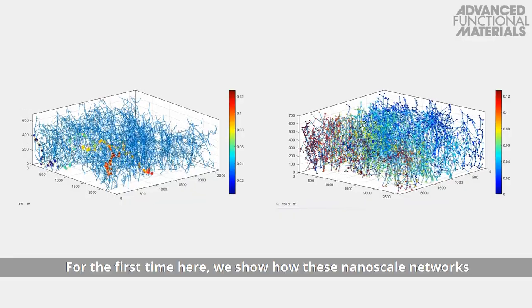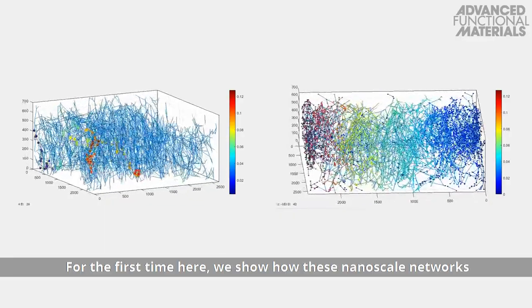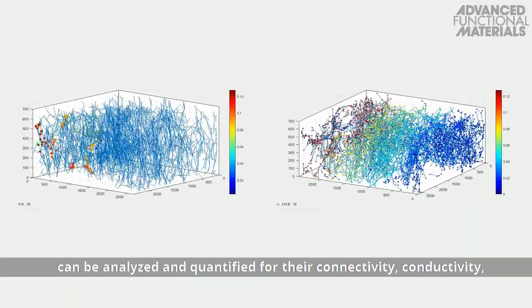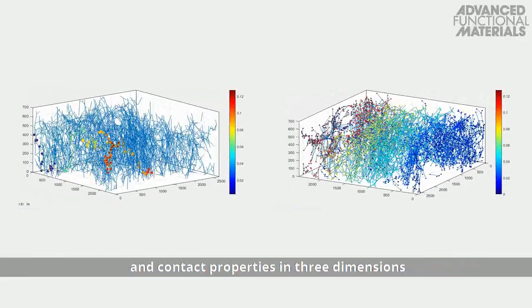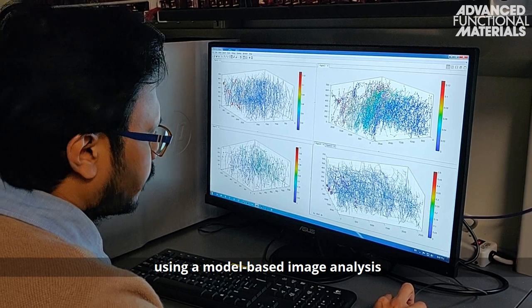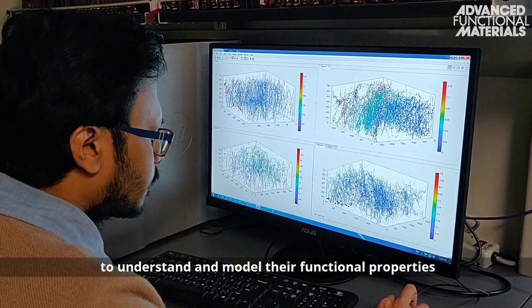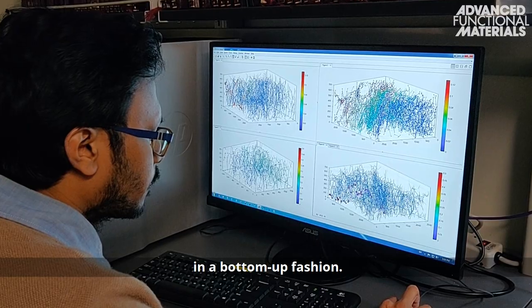For the first time, we show that these nanoscale networks can be analyzed and quantified for their connectivity, conductivity, and contact properties in three dimensions using a model-based image analysis, to understand and model their functional properties in a bottom-up fashion.